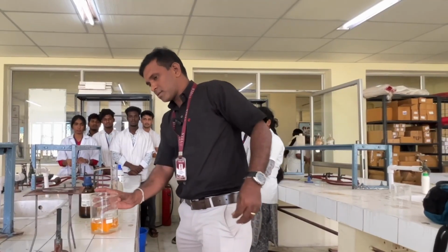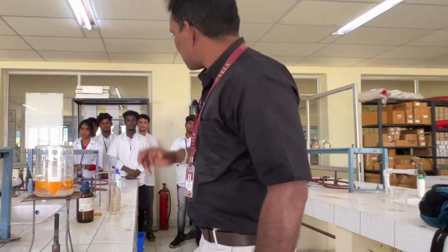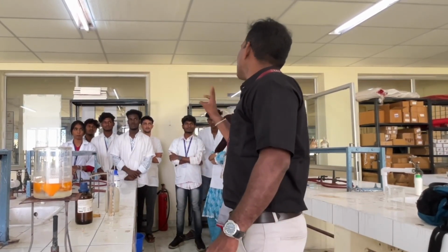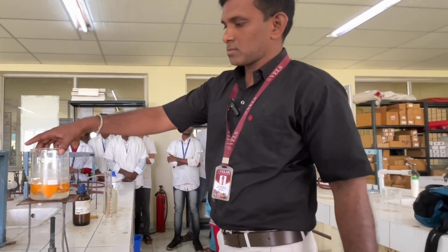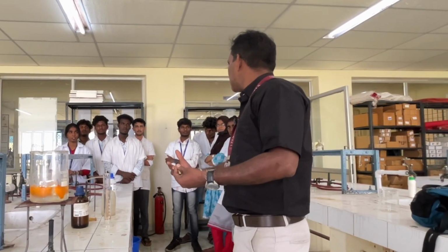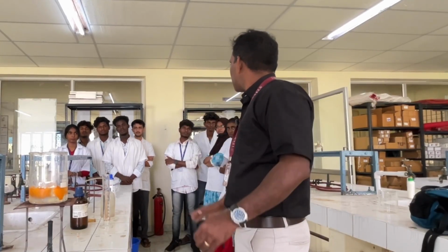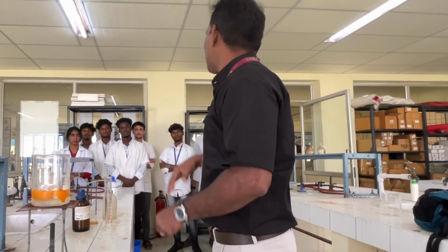And then heat this solution through a Bunsen burner, and you have to heat this solution for 2 hours. So where we are heating this is a simple process to remove that cell wall, because that compound is present in the lamella of the cell wall of the orange peel.